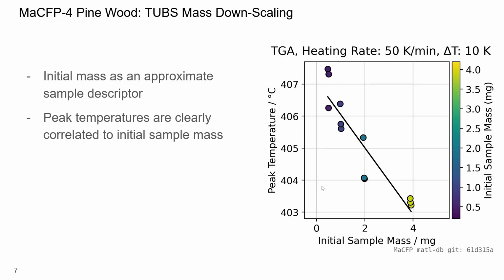The same result can be shown even more directly in this plot, where the peak temperatures are plotted against the initial sample mass. Now the correlation is clear. The peak temperature depends systematically on the sample mass. So far I have shown the effect in a controlled mass downscaling series. The next question is whether a similar pattern can also be seen in the submitted interlaboratory data.